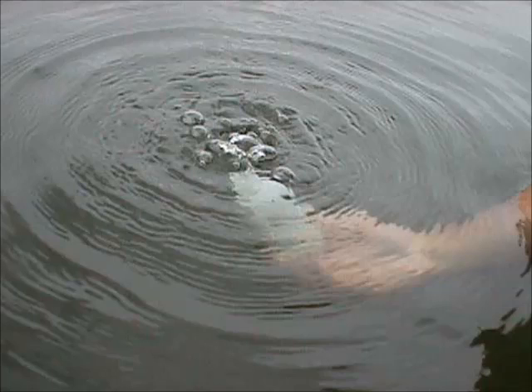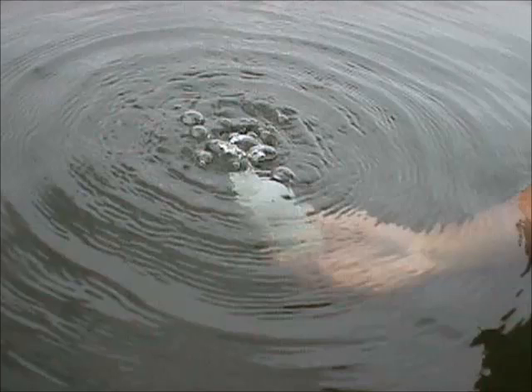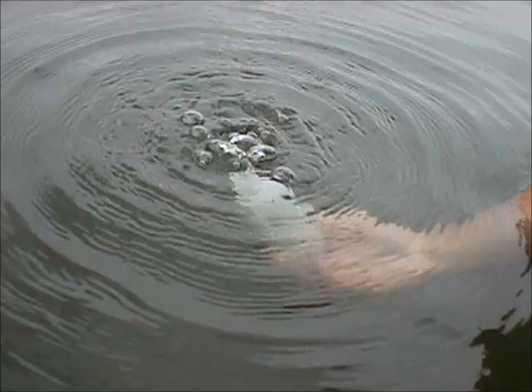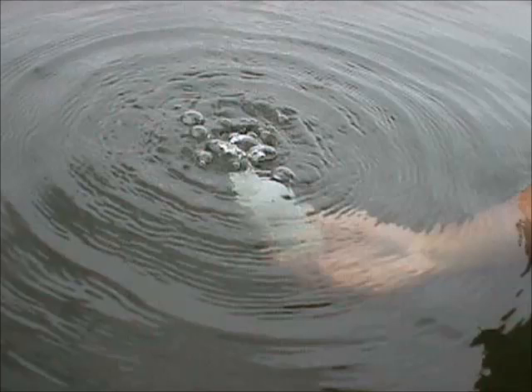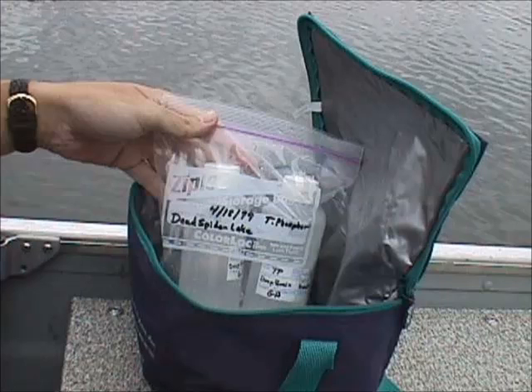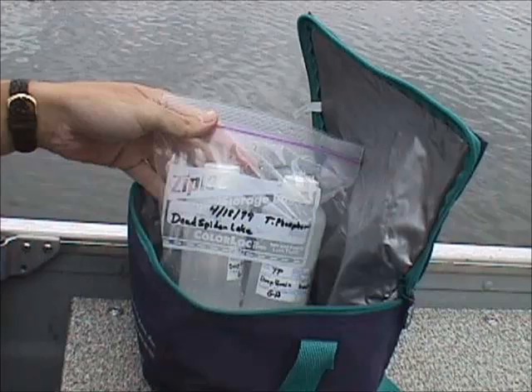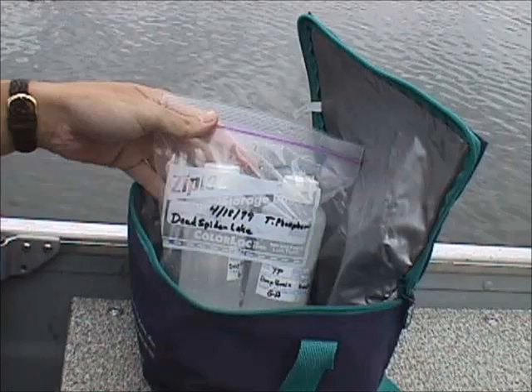To fill the bottle, lower the bottle with the opening pointed down to a one or two foot depth, a little longer than the length of your forearm. Once the bottle is under water at the proper depth, rotate it upwards to release the trapped air and allow water to enter. Repeat this sampling procedure with a second bottle to obtain a replicate sample. Pour some water out of the bottle to avoid cracking the bottle when you freeze the water sample. Put the bottles in a baggie and place them in a cooler bag with a freezer ice pack. As soon as you return to shore, put the water samples in the freezer and leave them there until it is time to turn the samples in. All samples must be turned in frozen or they will be rejected.